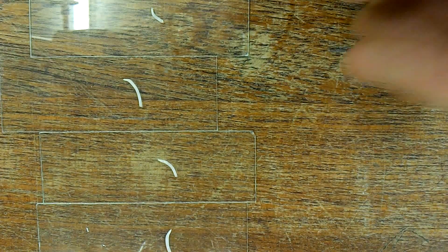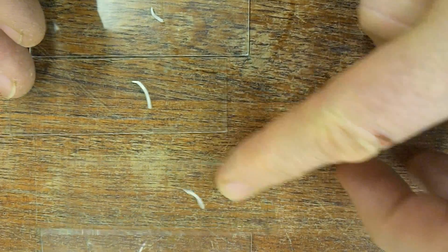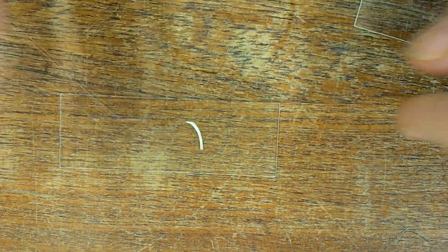There we go, there's our four tips. We're going to stain those. Right now, we're going to macerate the tip. I'll show you how to macerate one of these.